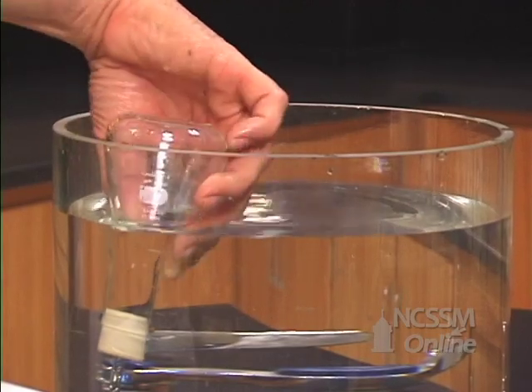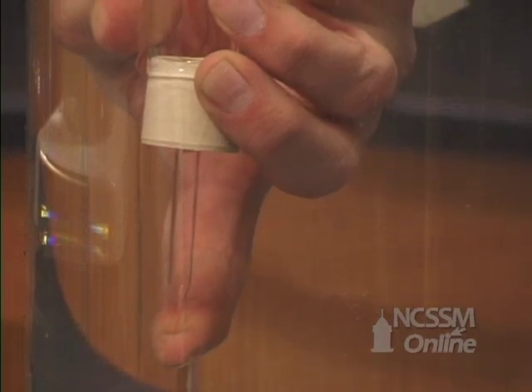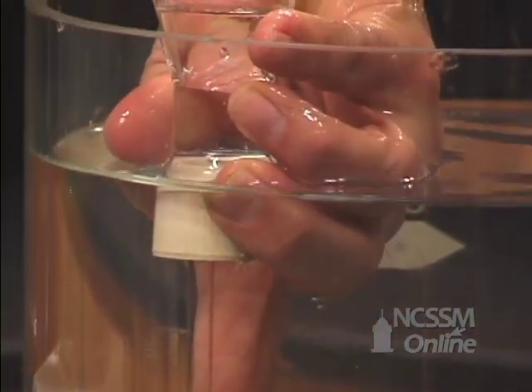I will now put my finger back over the tip of the stopper and remove the flask from the tank.